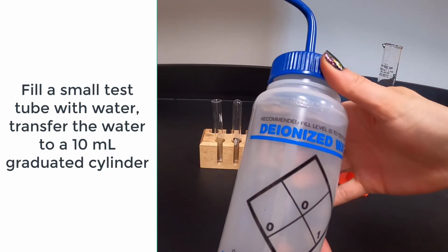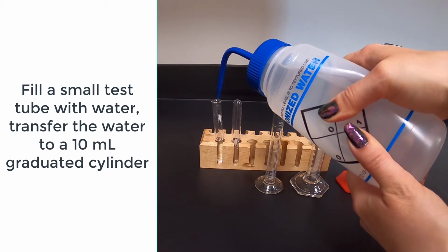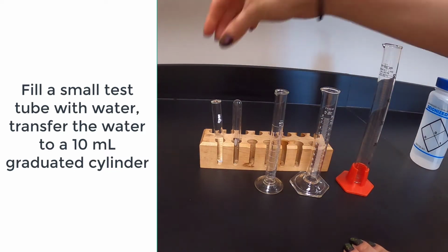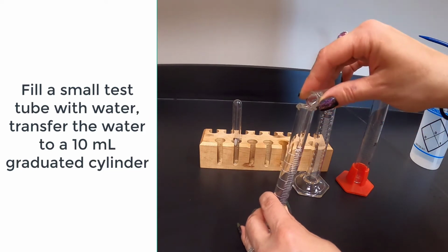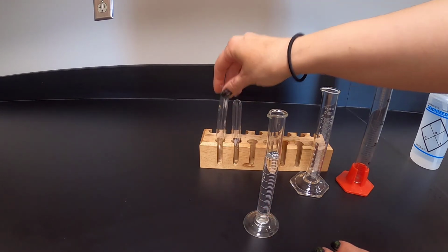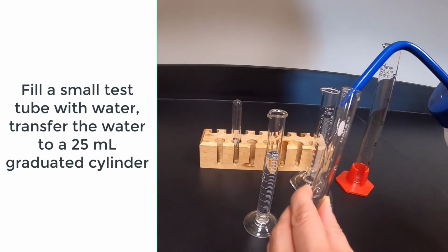Measure the volume of a small test tube by filling it with water. Pour the water into a 10 ml graduated cylinder. Repeat this step using a 25 ml graduated cylinder and a 50 ml graduated cylinder.